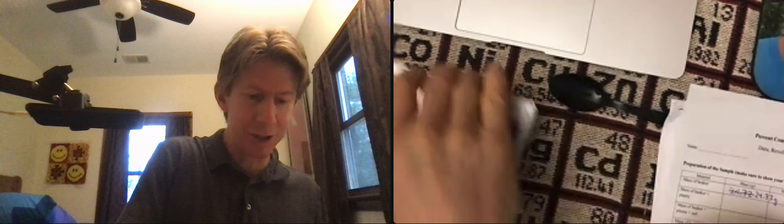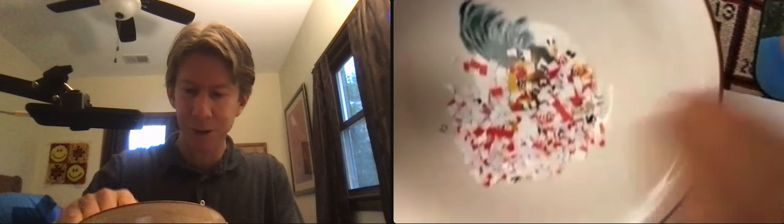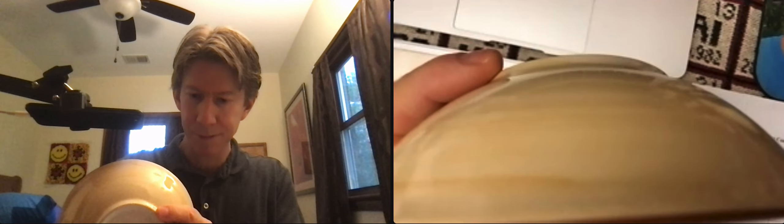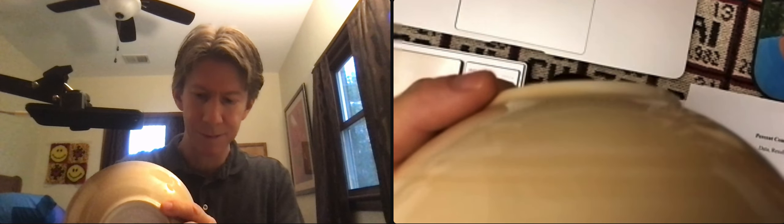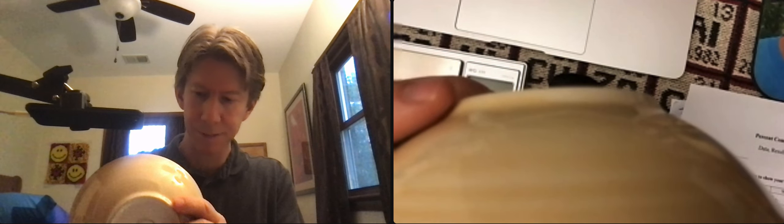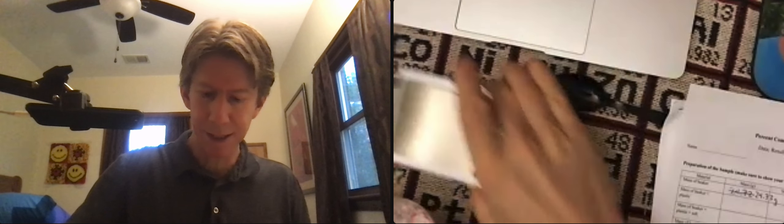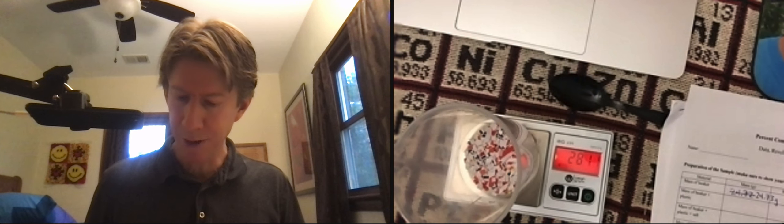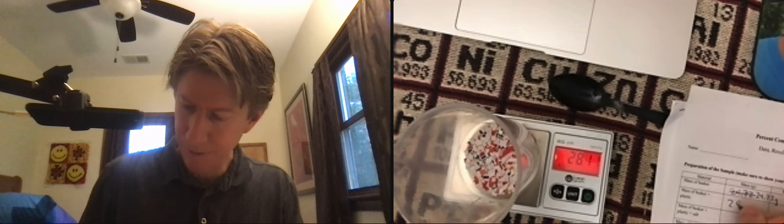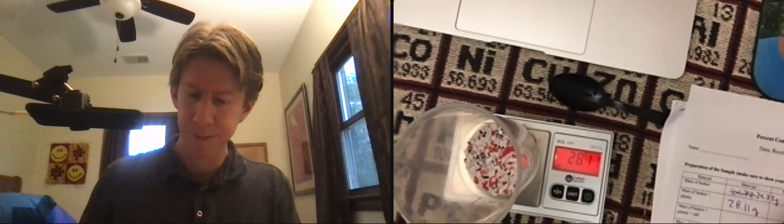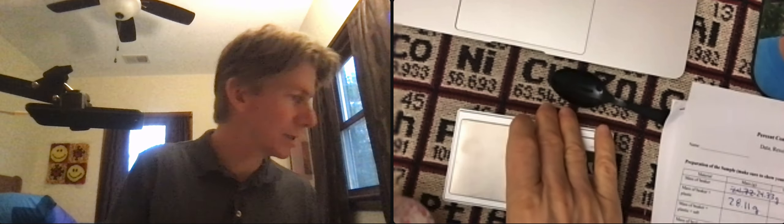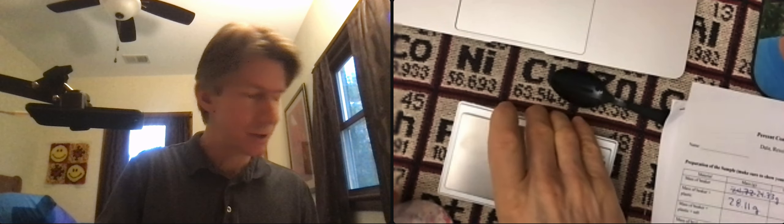And my scale shut off which it does. Anyway, so now I'm going to put all these plastic pieces in here. And then I'm going to weigh it again and now I get 28.11 grams. So we're making up our sample here that we're going to be separating soon.